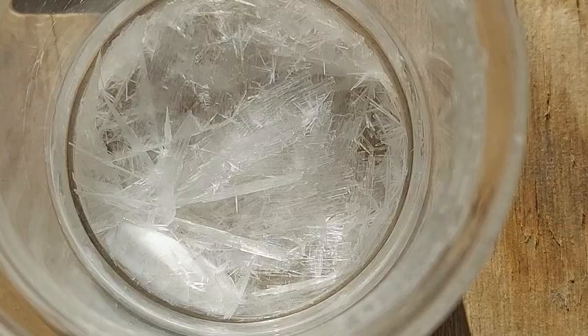What I'm going to do now is cool this down in some ice water to get as much to crystallize out as possible, then filter it. I'll have to evaporate down the filtrate a little more to get a second crop of crystals, but once it's been filtered, pressed dry, and ready for the desiccator we can wrap this up. It'll just be a white powder tomorrow — not a lot to see, but I'll come back when we're ready to filter and finish up.